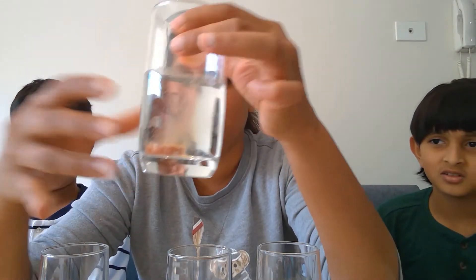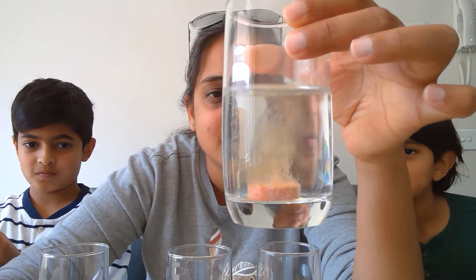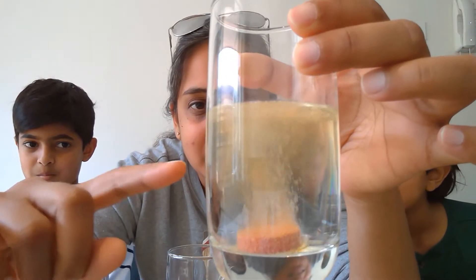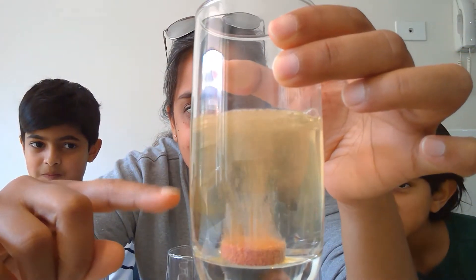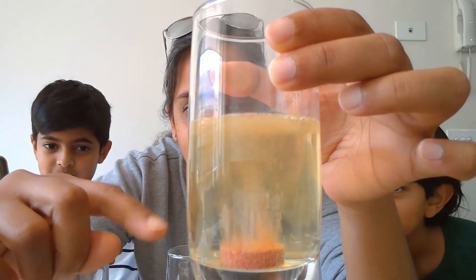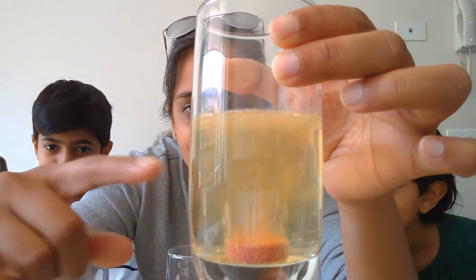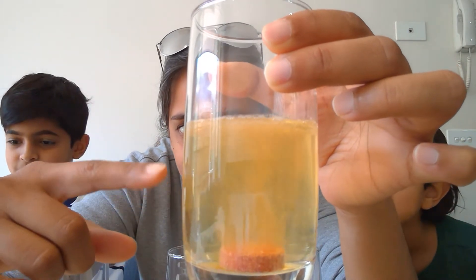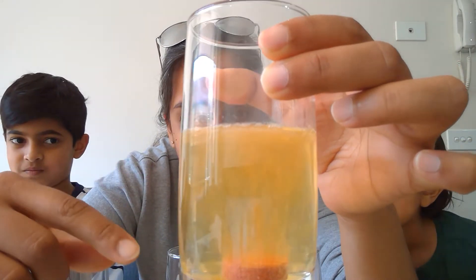Three, two, one, go. We can see these little bubbles — the citric acid and the base are reacting, and what's being given out is carbon dioxide.